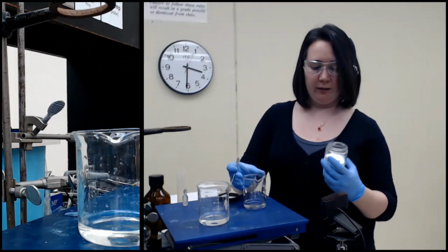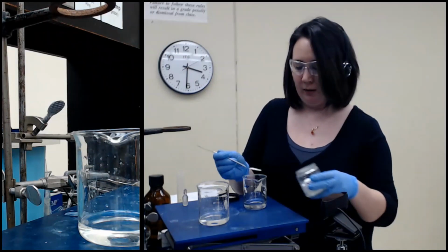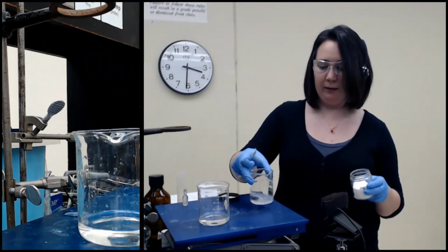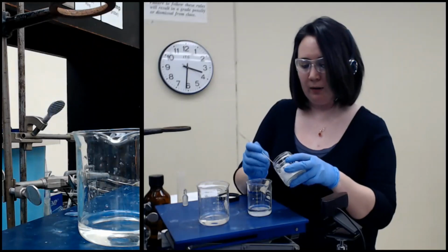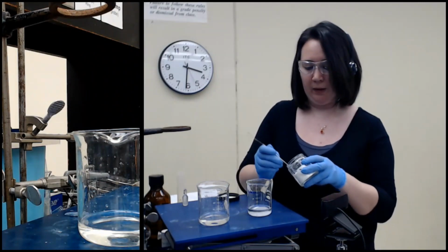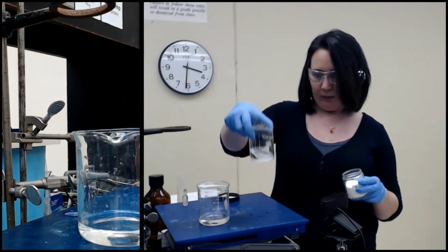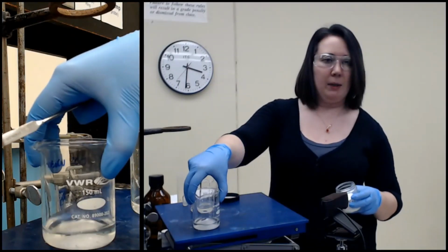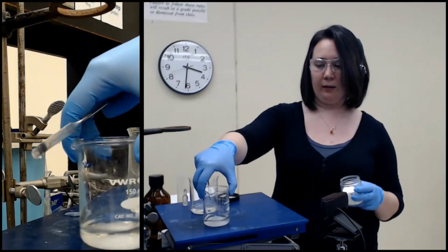So what that's going to do is anhydrous sodium sulfate, it would like very much to form a complex with the water. So anhydrous means it's not currently complexed with water, but if we add it to something that has water, it is going to be very happy to take that water up with itself, thus sequestering it from the rest of the liquid. So I would usually use like a scoop maybe, but what you're going to do is add until you see it stop clumping, because as it's clumping, that means that it's still finding water to, I guess, technically react with.